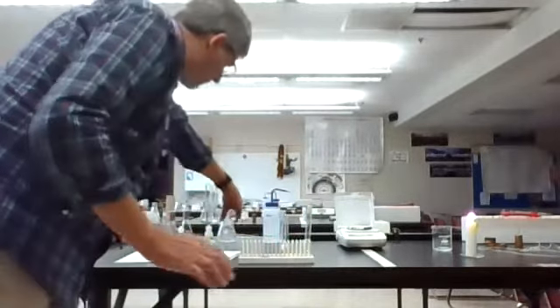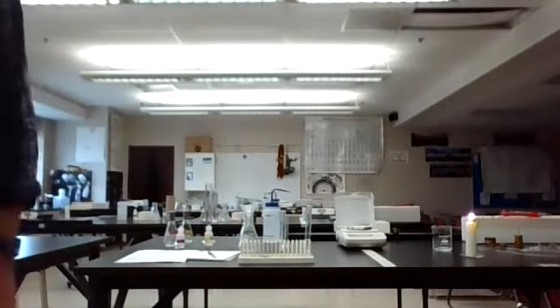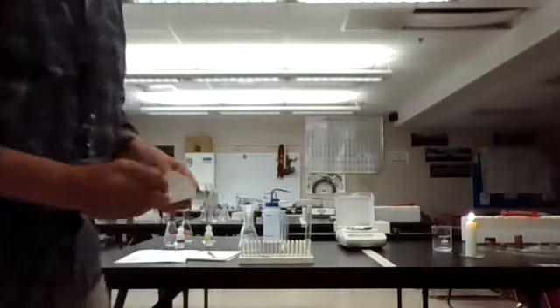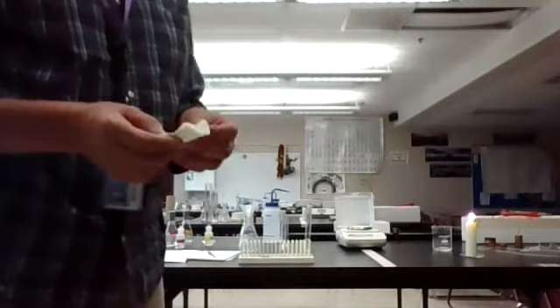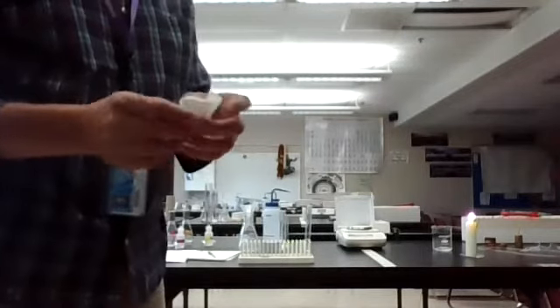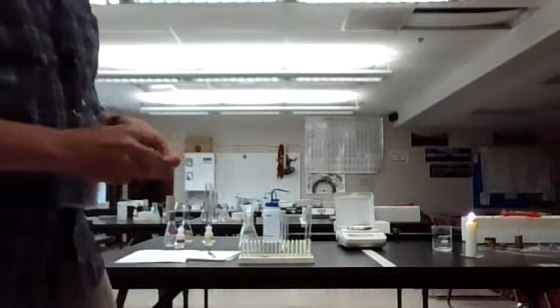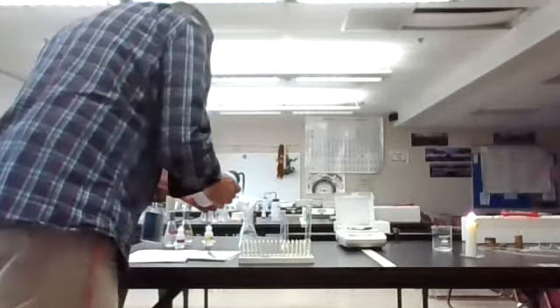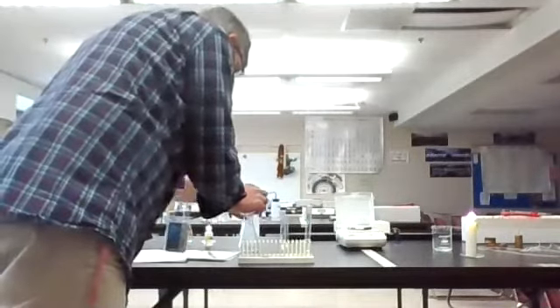Okay. The next thing we're going to do is actually filter this out. We do a filtration, that's called a gravity filtration. I've already prepared a piece of filter paper. This is what we call fluted filter paper. It's just a normal piece, and then you just make the best crease you can on this thing. Okay, and you go ahead and put it into the funnel. And what I always think is a good idea is to get this thing wet, and that keeps the filter paper sort of sticking to the funnel for us a little bit.